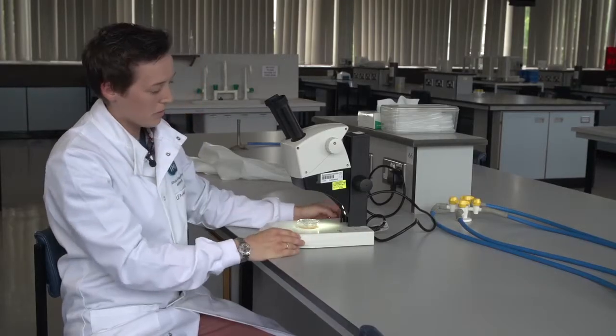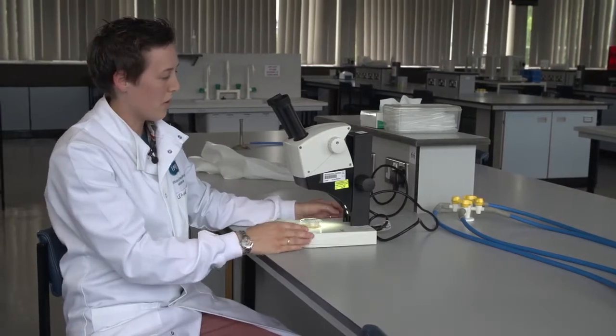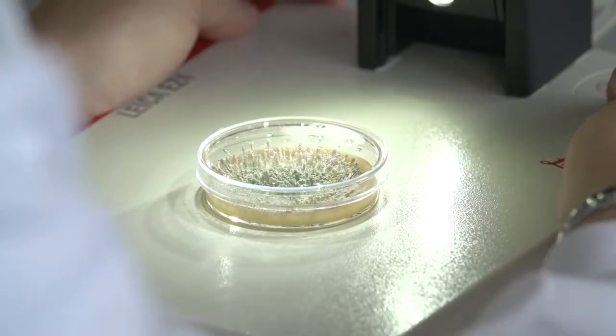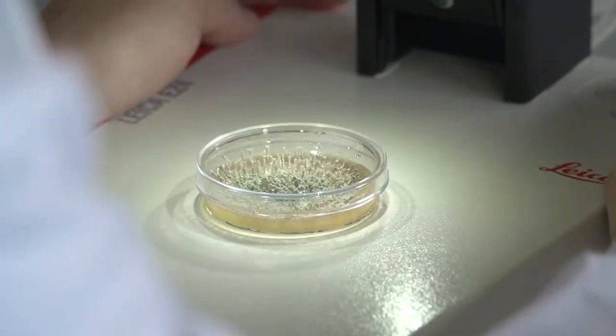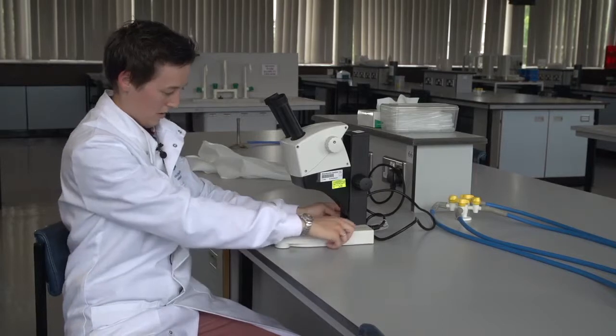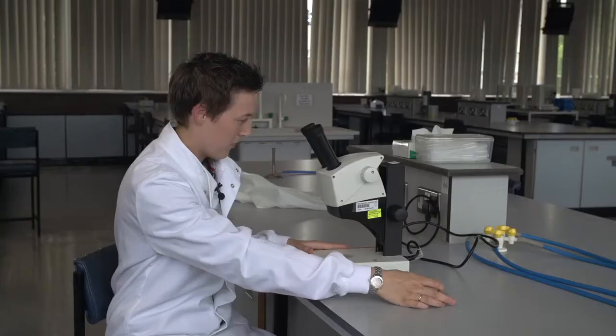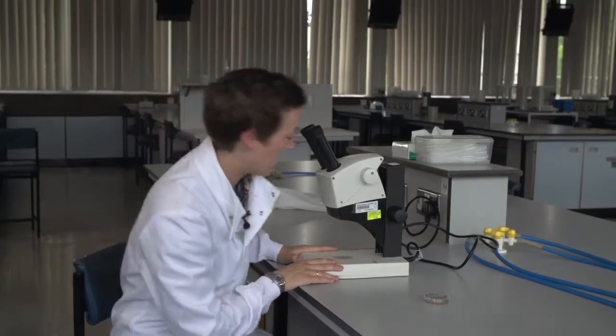Once I'm finished using this microscope, same as the previous microscopes, we want to switch the lights off and put it back into the cupboard. So we just turn our lights off. We're removing our specimen and replacing the cover back on.